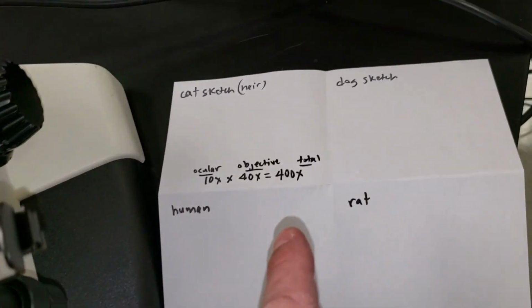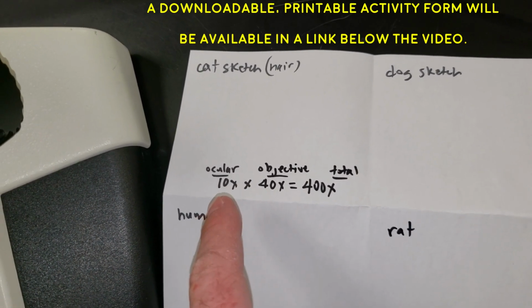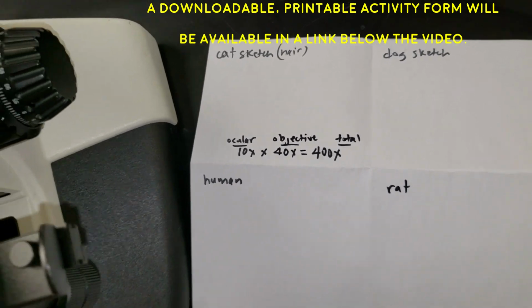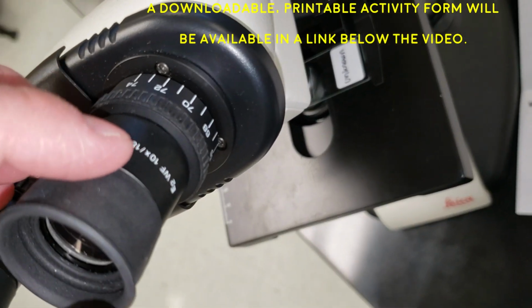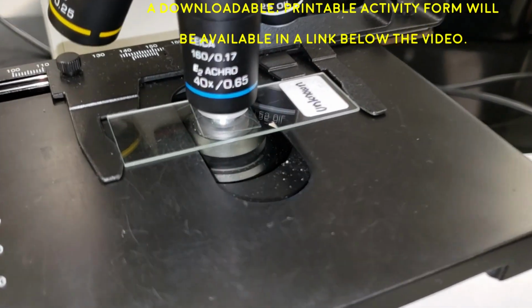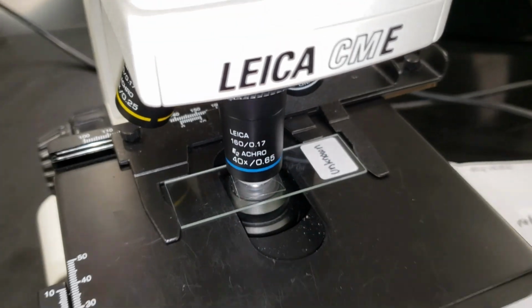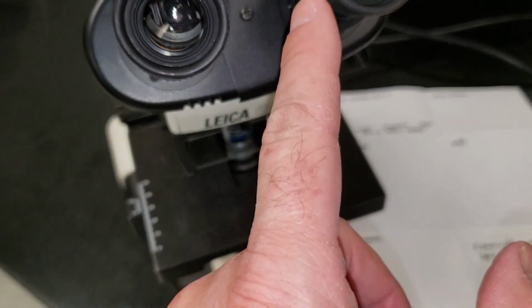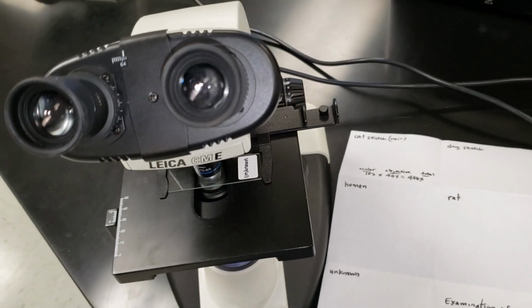On your sketch paper, I do want you to put your total magnification. That's the ocular multiplied by the objective. The value for the ocular is noted on the side, 10x, and the objective is seen here at the bottom. You can see this. So 10x ocular, 40x objective. What is that total? 400. 400. Lovely.